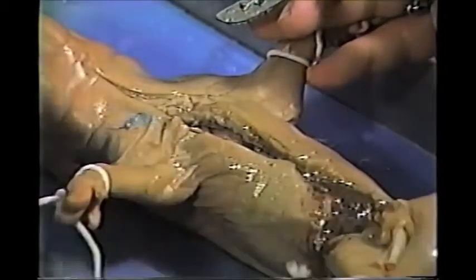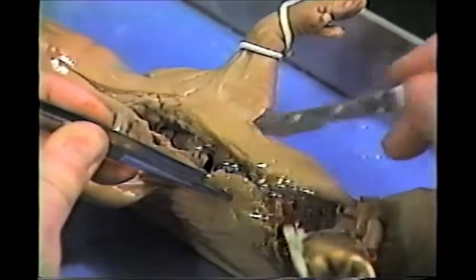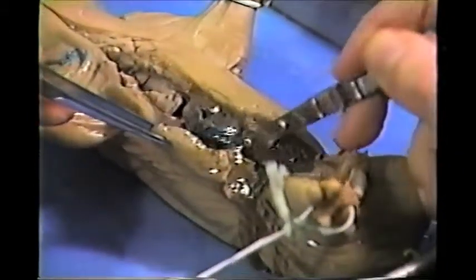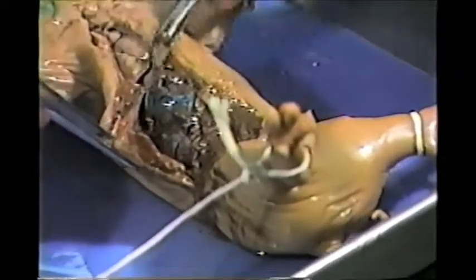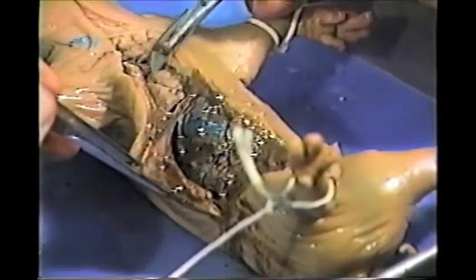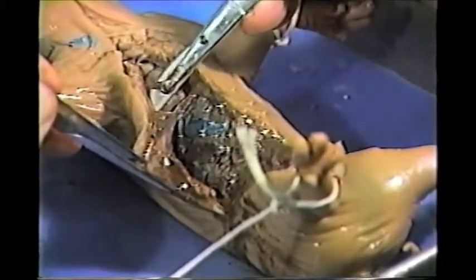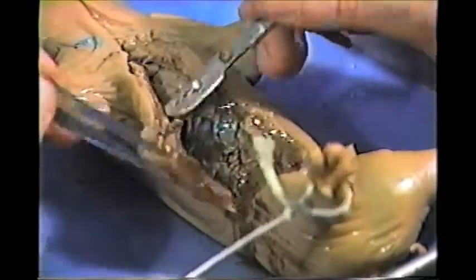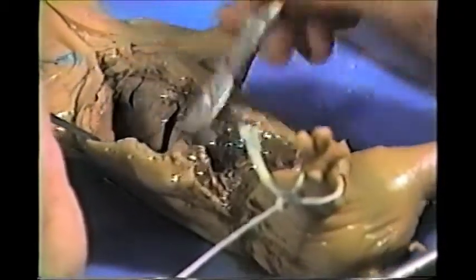and now we're going to take the forceps, pull the skin and other tissue back, and kind of separate the internal organs from the wall of the abdomen. Right here is the diaphragm. The diaphragm separates the thoracic cavity above from the abdominal cavity below, and it's attached to the side wall. Try to cut this near the connection of the diaphragm and the wall.